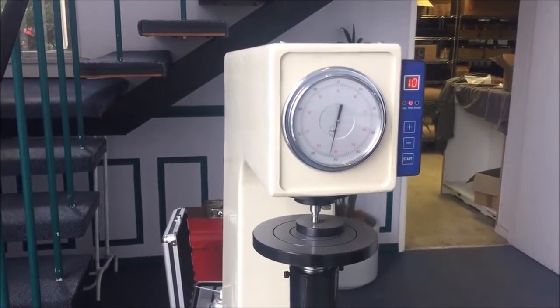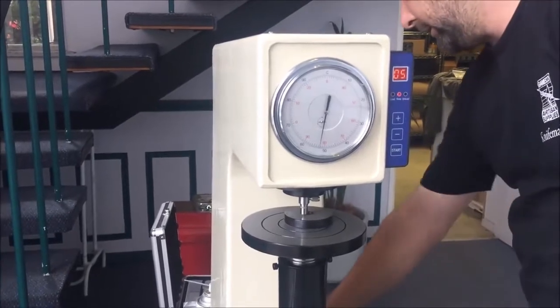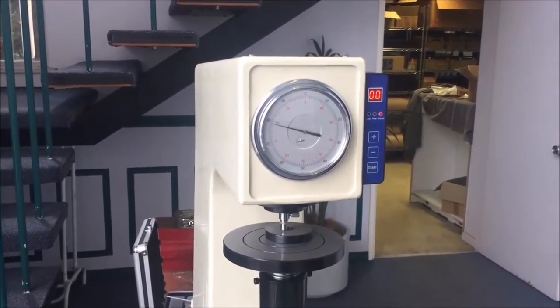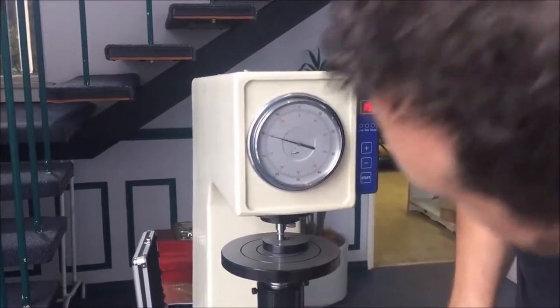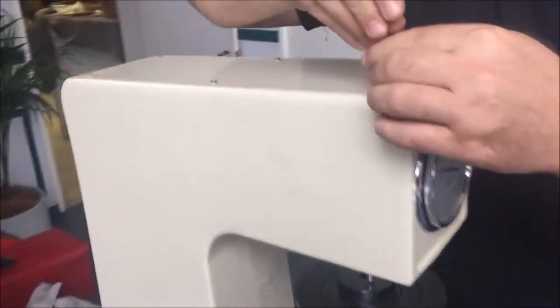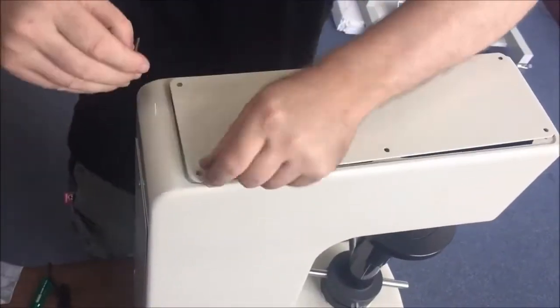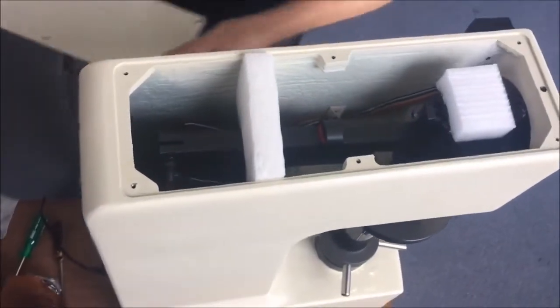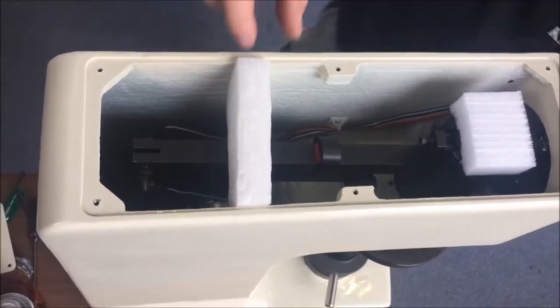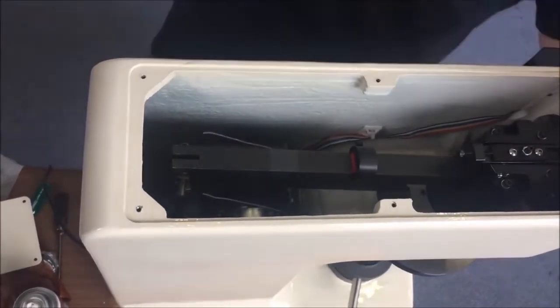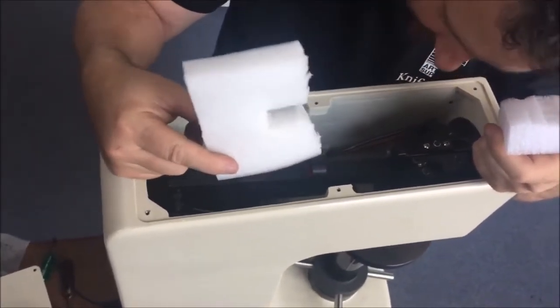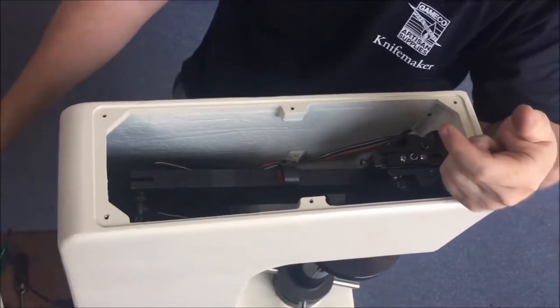It won't be helping that this whole machine rocks on this table. You need to have yours on a solid base, but I'll still go through the process. And it's giving us a reading of 79 Rockwell. So, 61.5 block now close to 80 Rockwell. So we're going to now take off this top cover. This is why I made the video. We're going to break the machine so you don't have to. I'm guessing the reason that it's not reading as accurately as perhaps it should is that somebody left packing in the top here. I'm not sure who that was, but I'll track it down and we'll give them appropriate counseling. Terrible. All right, let's start again.